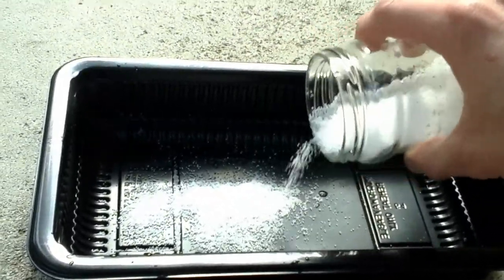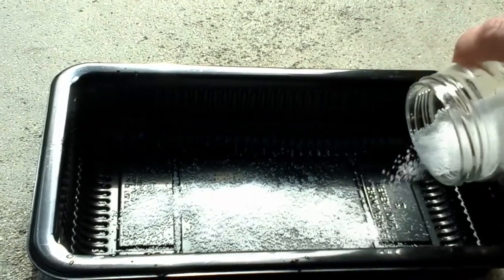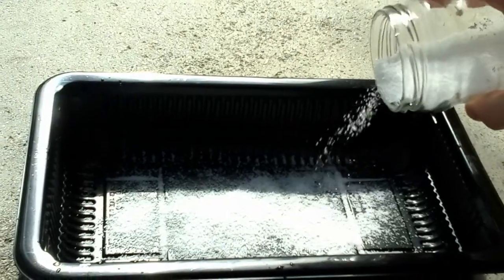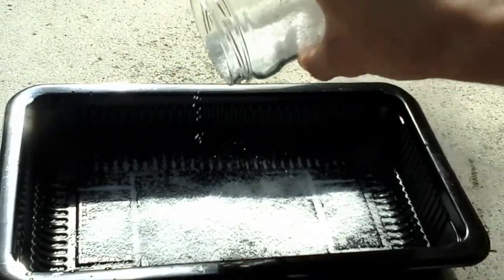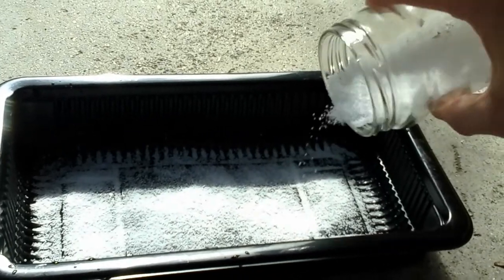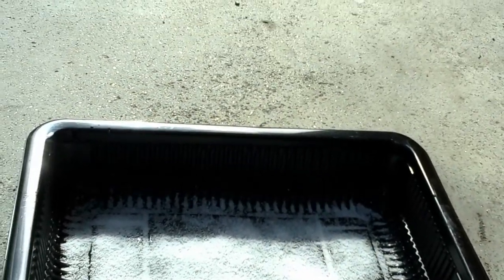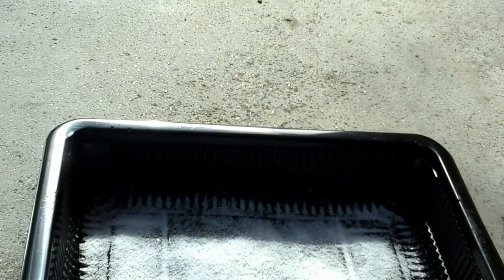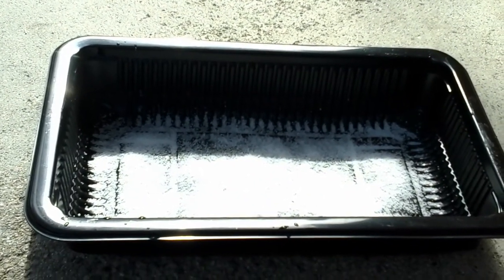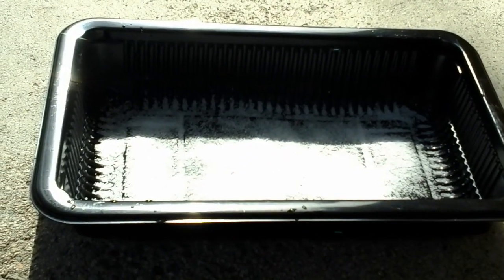You could pour the hydrochloric acid straight into this jar and it will generate a little bit of gas, but nowhere near as much as when you space it out evenly. I don't know why that is, but maybe a more advanced amateur chemist could tell me. You'll see right now the production of sulfur dioxide.